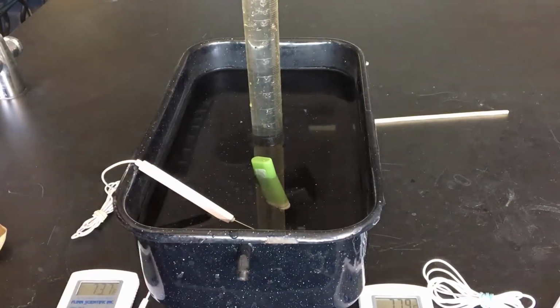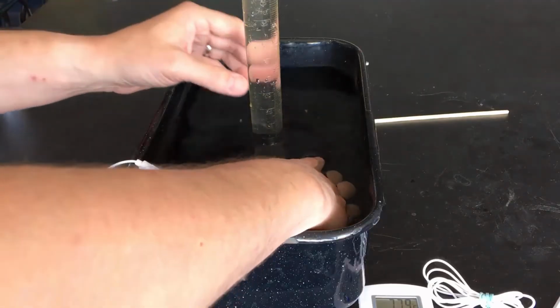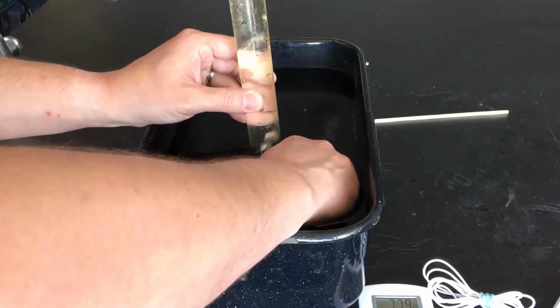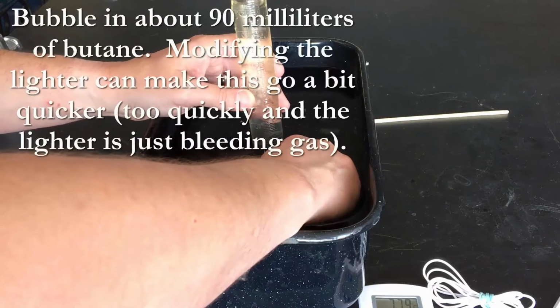All right, let's go ahead and bubble about 90 milliliters of gas into the graduated cylinder. As the gas goes in, it will push water out. And a modified lighter will allow this to go much, much faster.